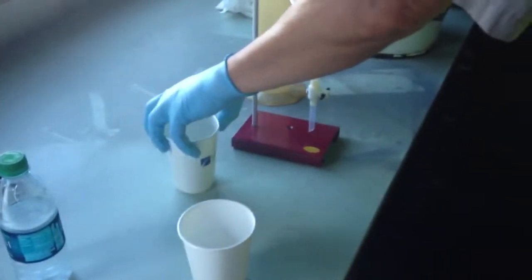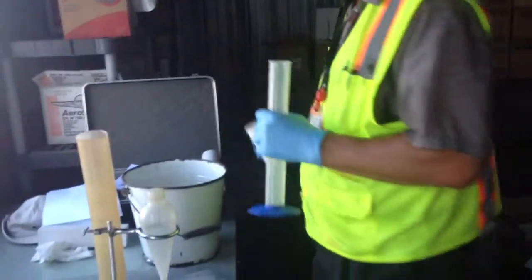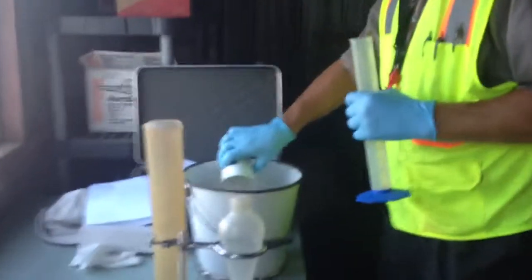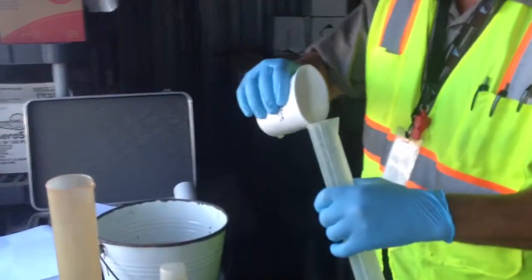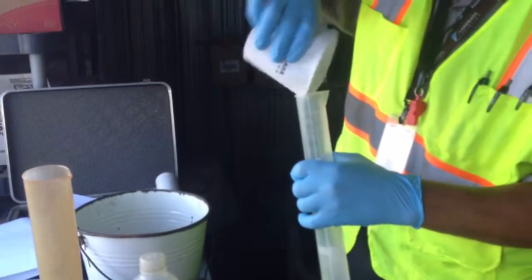But I'm going to take empty cup right here, and I'm going to put 80 milliliters of fuel with press, exactly 80 milliliters.